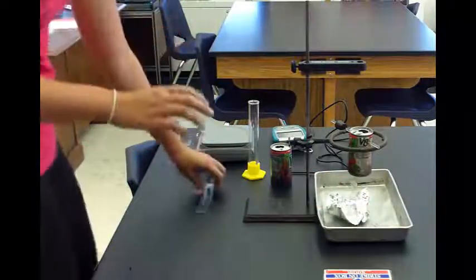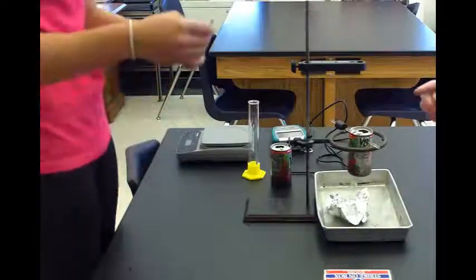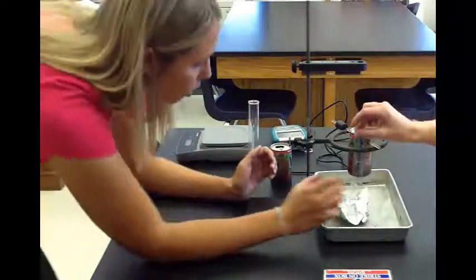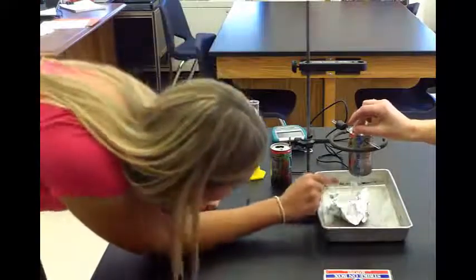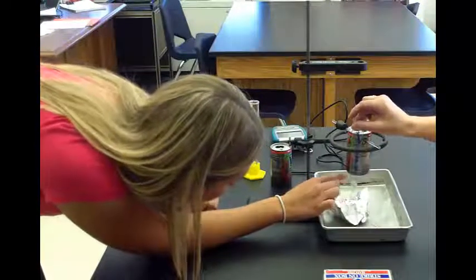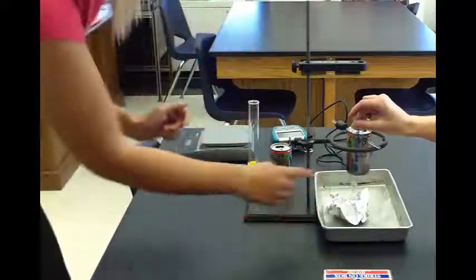You're going to need two people for this next part because it's difficult to do. Take the ruler to look and see how close it is. You need it one inch from the top of food to the bottom of the can, which it is right now.